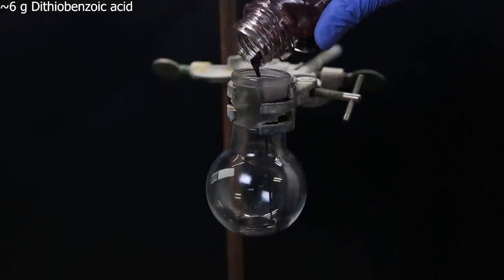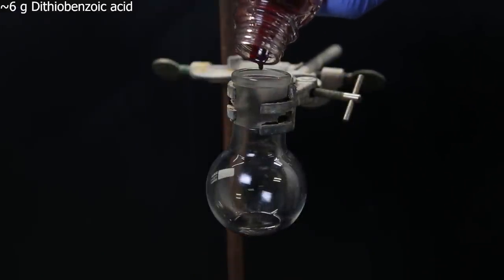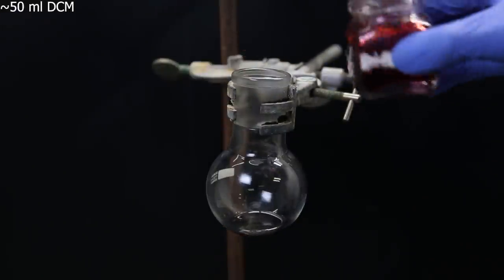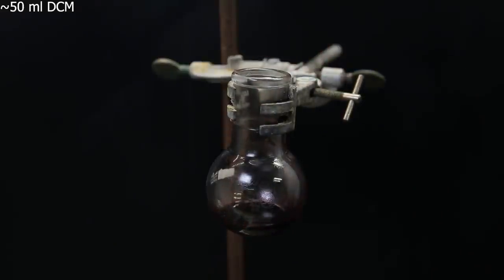Now for the next step, I heated the other half of the product, to get it to liquefy, and pour it all into a flask. I washed the container with about 50 ml of DCM, and transferred that to the flask as well.